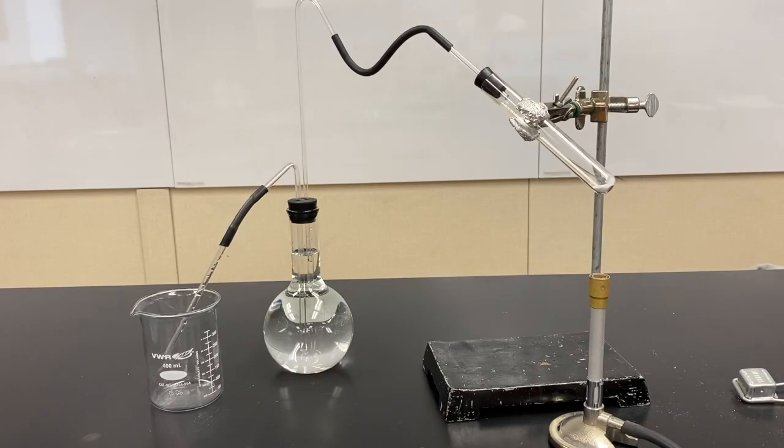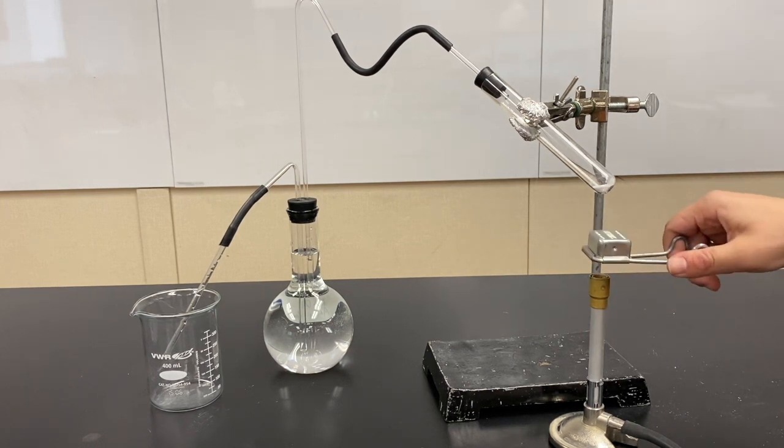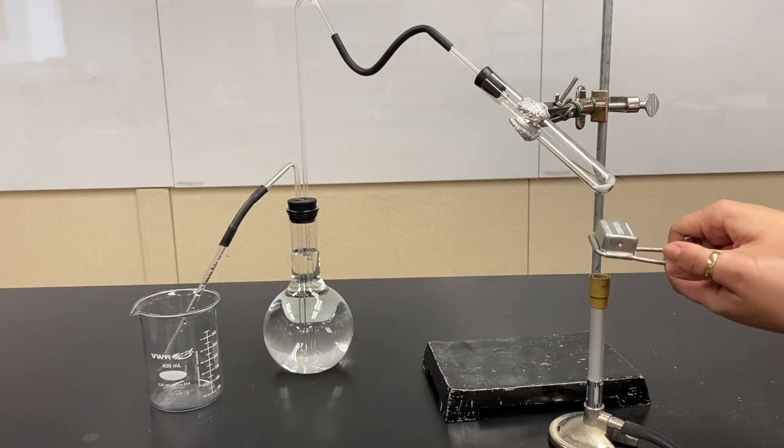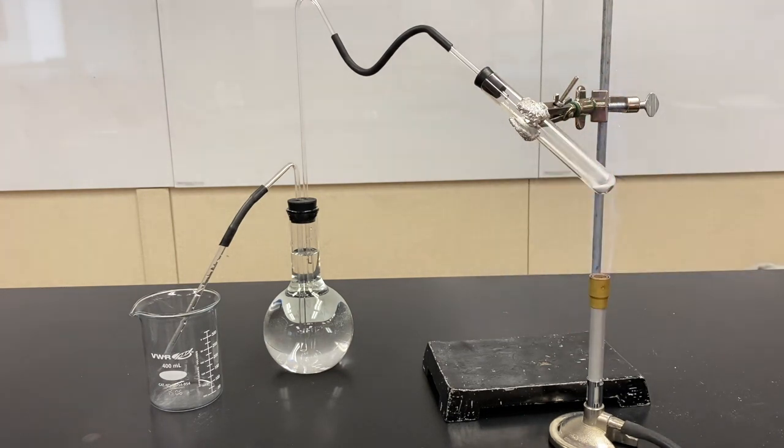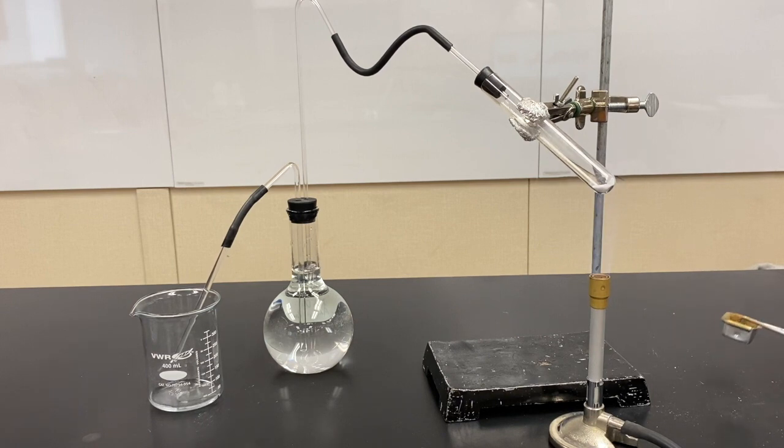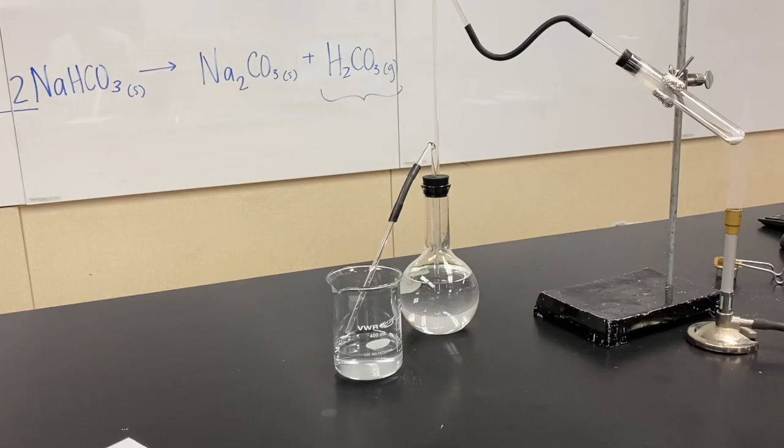Okay, so I'm going to do the same thing for unknown D. Here we go. Let's decompose it. And there it goes. Oh, there we go. Reaction's done. Perfect.